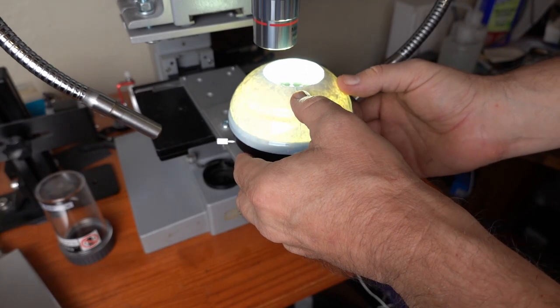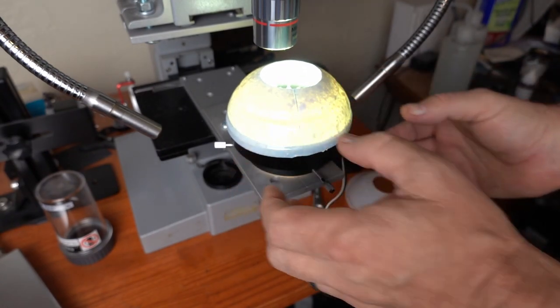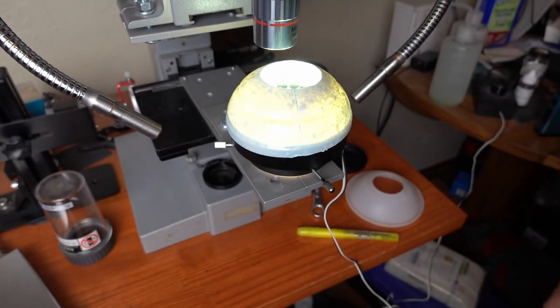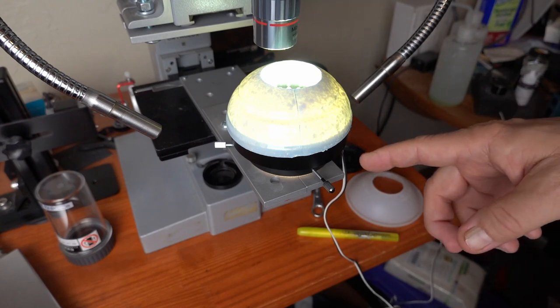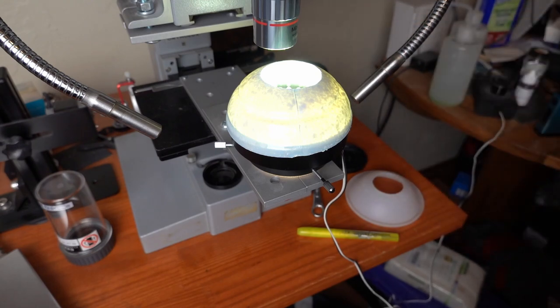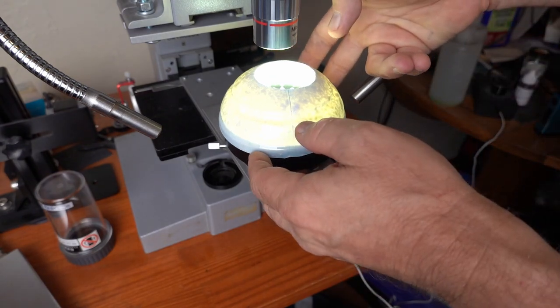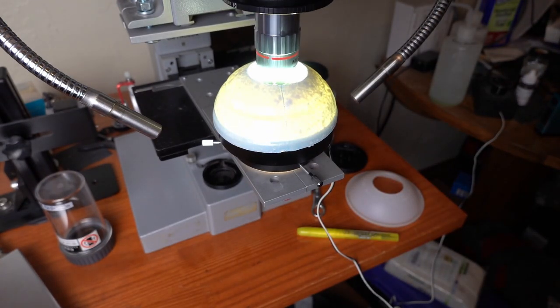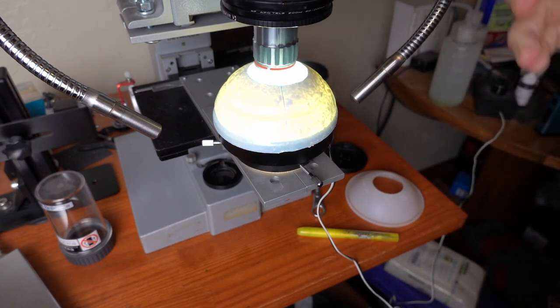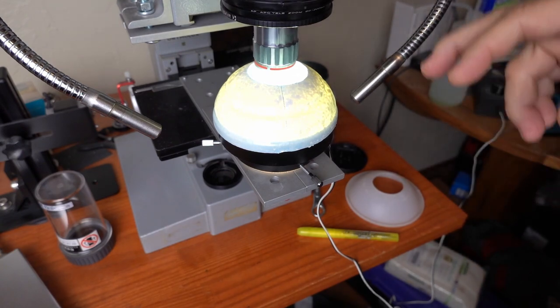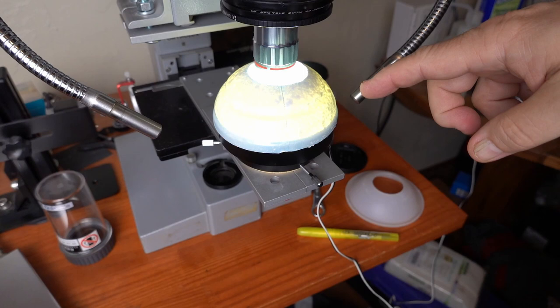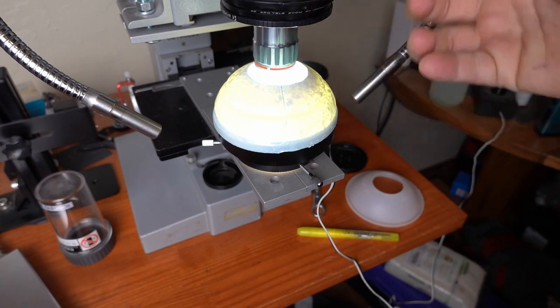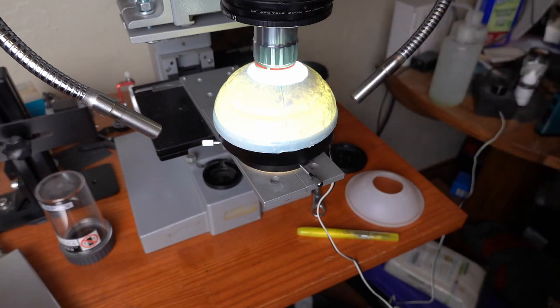This would then go under here. Now you've got the ring light coming up towards the objective. Then when you put this on, it reflects the ring light. You can see that mottled paint as it comes through there, but it looks real nice and softened inside. So now the light comes up from the ring light, reflects on the dome, and comes back down towards the subject. You can get a very uniform lighting in there. I use this sometimes, but I find that it's not a whole lot different than just putting the ring light on top of the dome. Once I get it set up, I can use my long Arca Swiss to drop the objective in there. You tend not to want to put the objective inside the light dome, you'd like to keep it outside, but I can't do that. But it works pretty well. It's a neat technique.